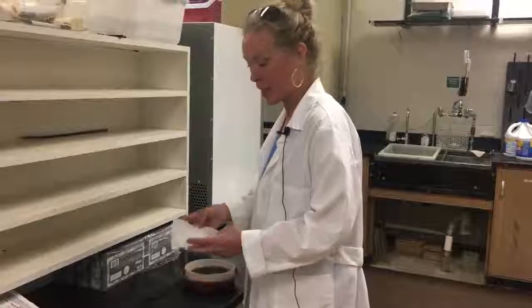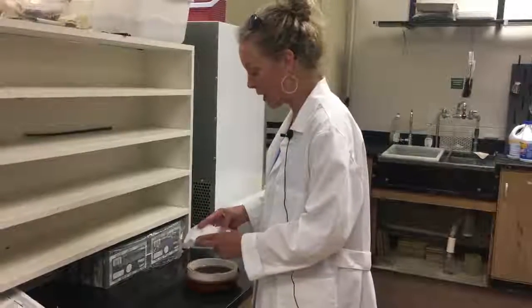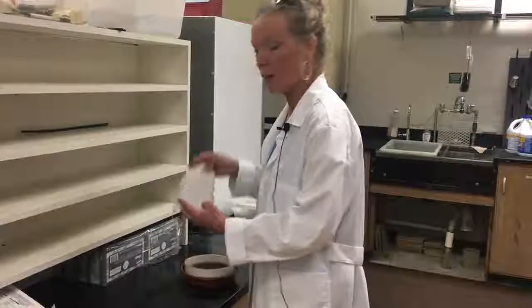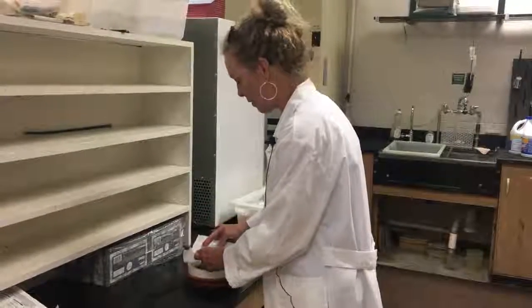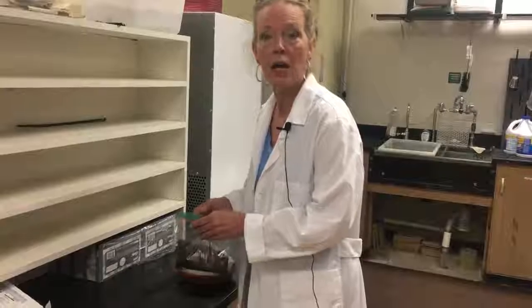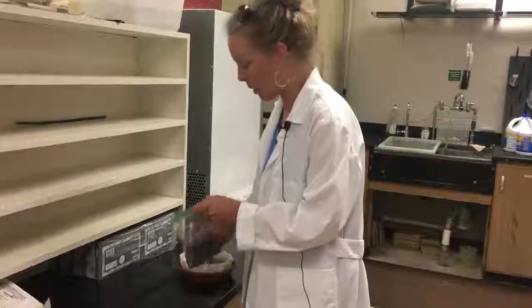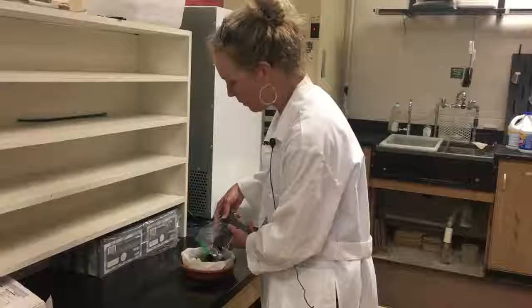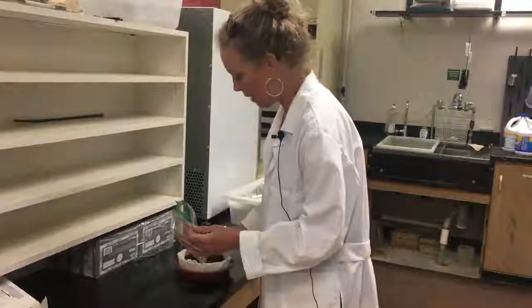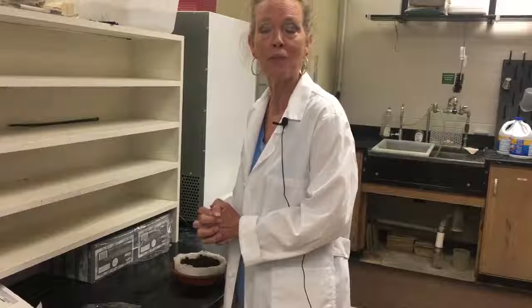We have a screen that goes down into the water. I put a tissue paper on top of that carefully, and then 250 cc's of soil goes into the top of the tissue paper. I kind of spread it out, even it out, and then we're done. In 24 hours we will read what nematodes might be under the microscope.